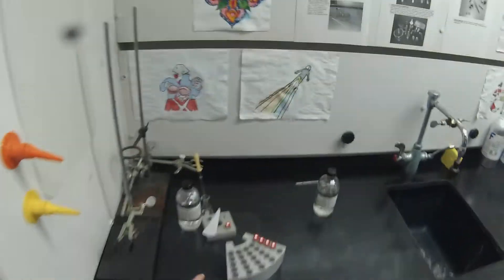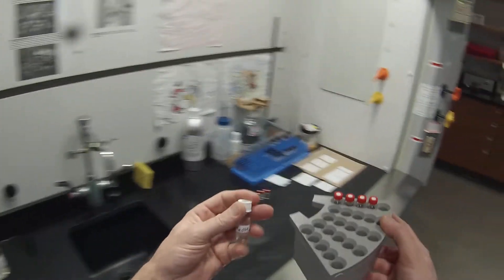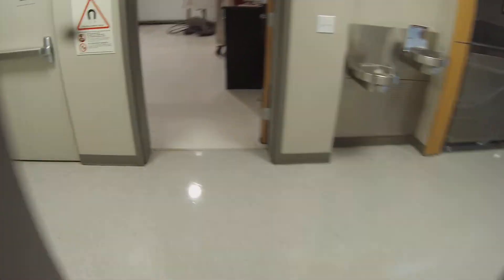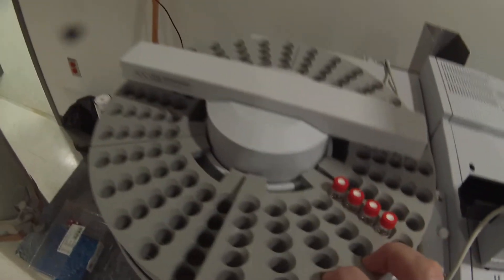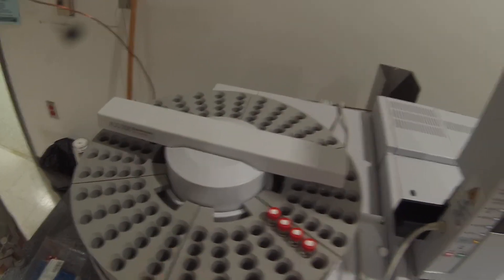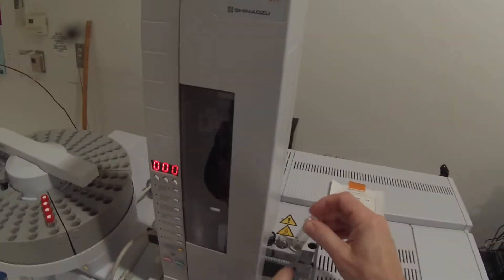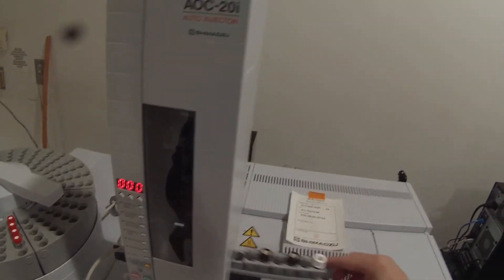So I'm going to take my methanol wash bottle and my GC mass spec rack over to the instrument. And I'll put this in slot one. So it really does correspond to samples one through four. And then the methanol goes here. That's solvent A.